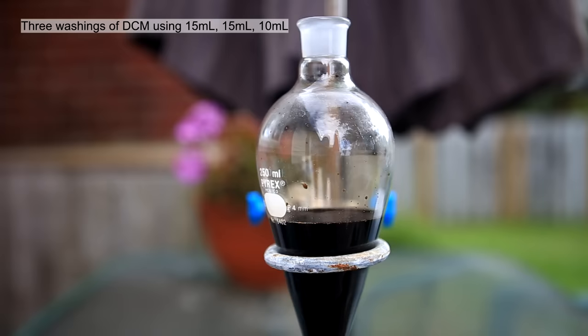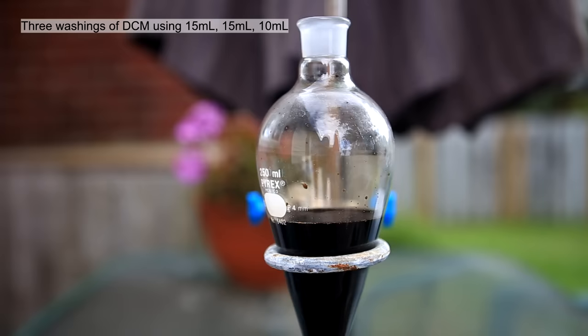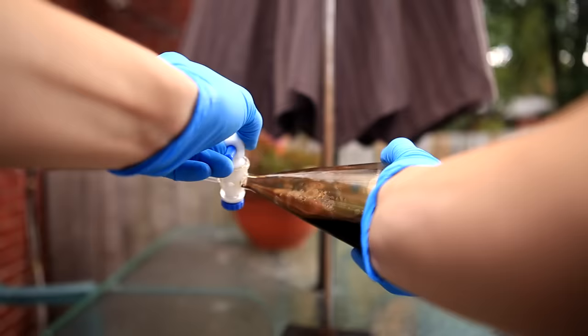And now for the fun part where the coffee is transferred to a separatory funnel. Then to the coffee we add 15 milliliters of dichloromethane. The caffeine is much more soluble in the dichloromethane and will be pulled from the water.